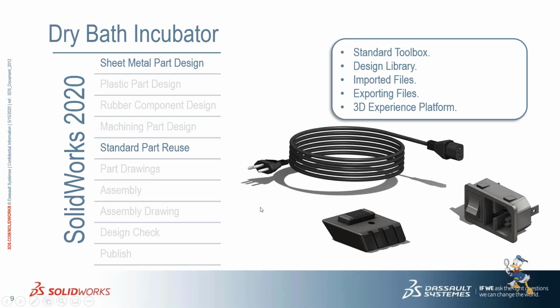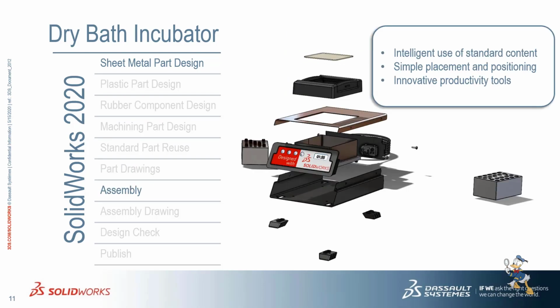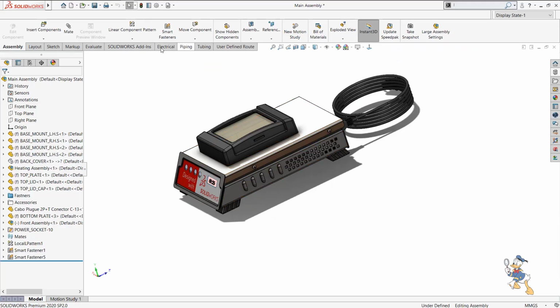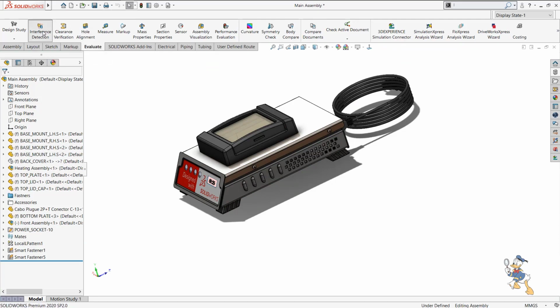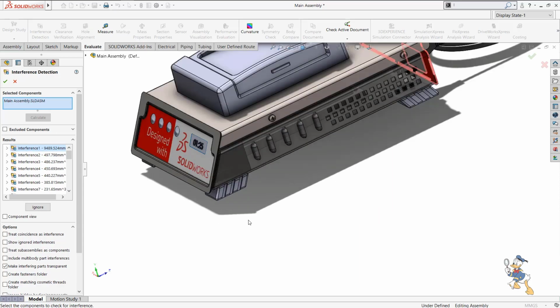We have used standard parts like sockets, we have used the drawings, we have done assembly drawings also. For design check, suppose we need to do some sort of design check in it, we have an option of interference check. We can calculate whether some sort of interference is there or not previously to release our design. So we can do this by checking it out.